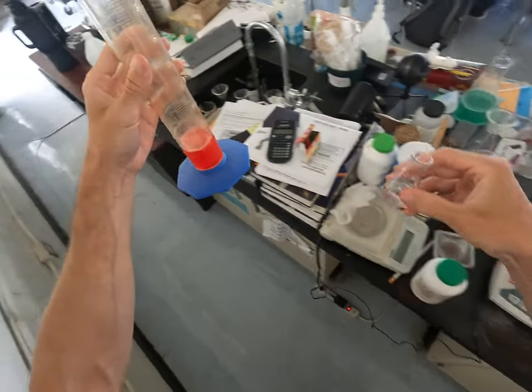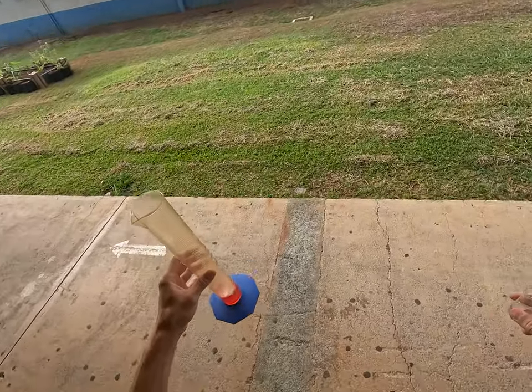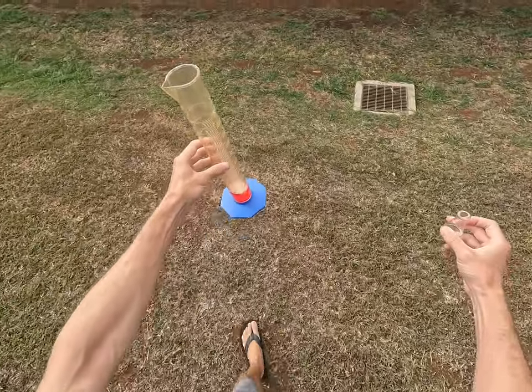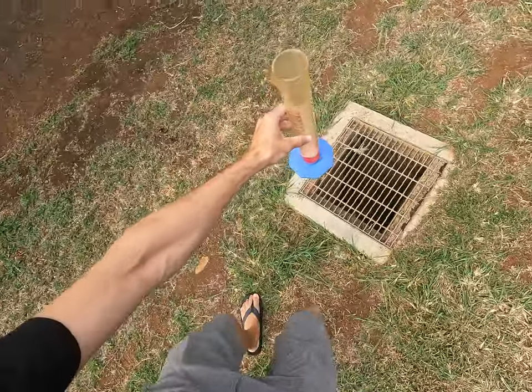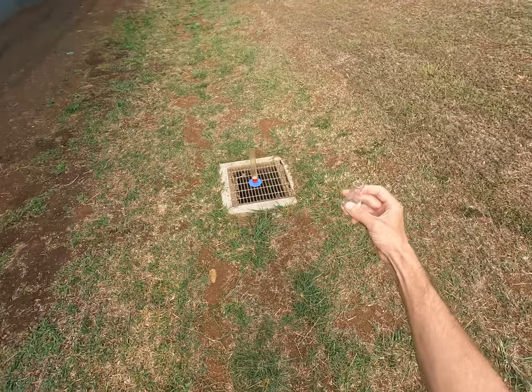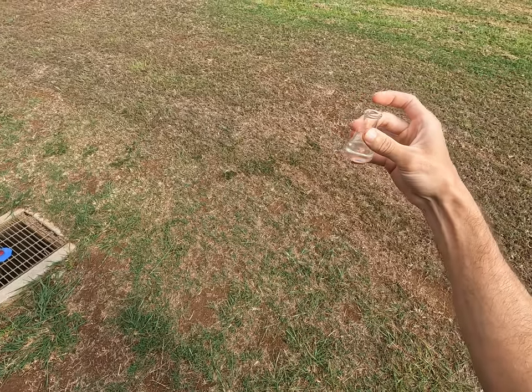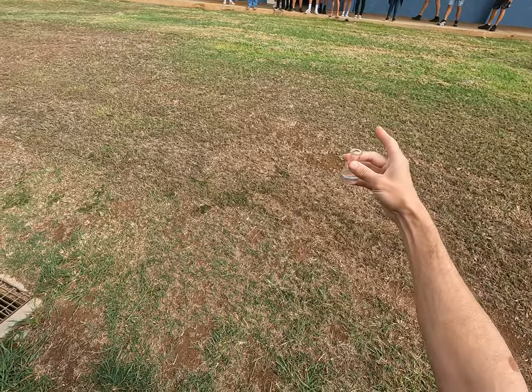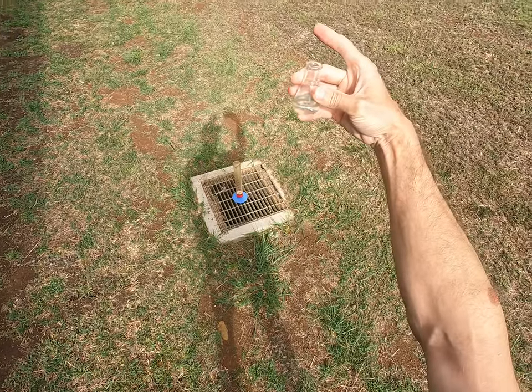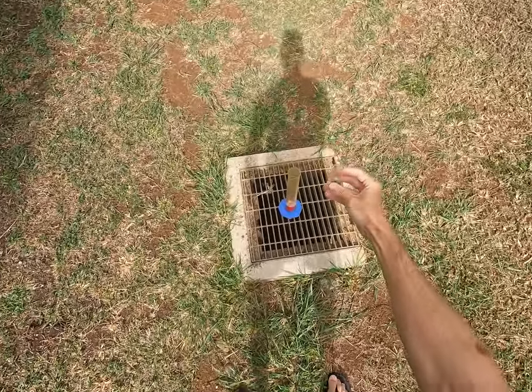All right, let's go outside. So I have here the stuff that I made up earlier. This is two molar — we'll talk later about what that means — two molar potassium iodide. This is the stuff I was ranting about being useful for keeping radioactive iodide out of your thyroid in the event of a nuclear release. Hopefully this works.